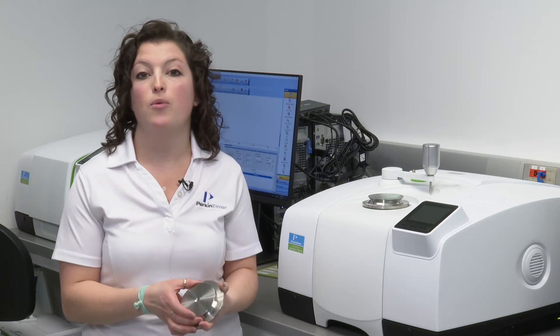For instance, germanium cuts off at 780 wavenumbers, whereas something like diamond or zinc selenide cuts off around 550. But if you drop down to something like KRS-5, you can get all the way down to 250 wavenumbers. If you have important features in that lower region, this is going to be a huge aspect.